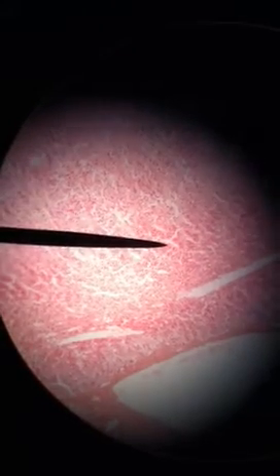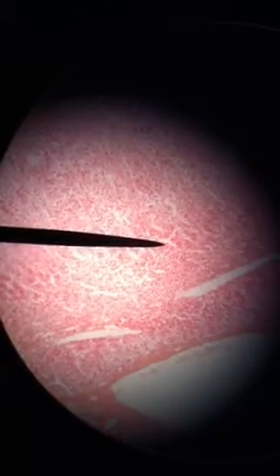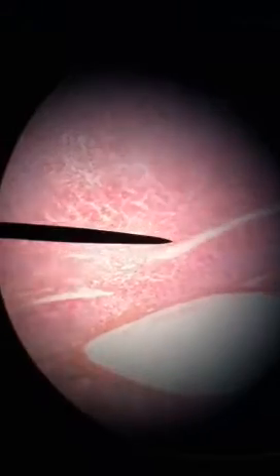So where are the chief cells on the slide? It's going to be further down — right there. And you can see where it starts to flip itself back over.